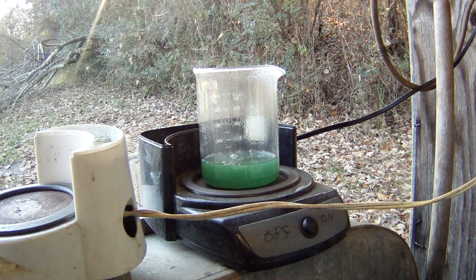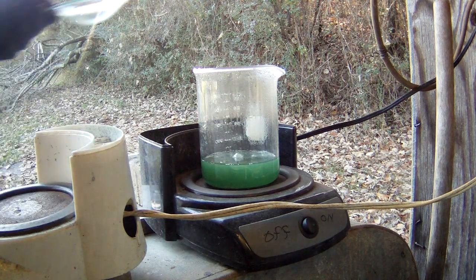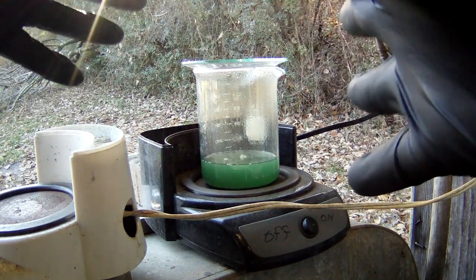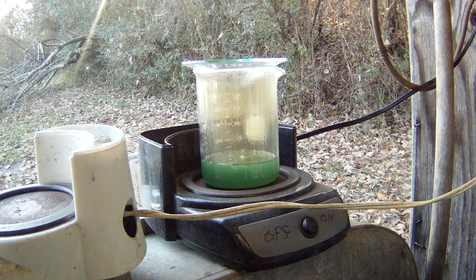Let me get my towel. And yeah, instantly we've got some more reaction again, so we still have quite a bit of material to dissolve in there. We're just going to go ahead and let it do its thing. And always remember, nitric acid, silver, wear your gloves or your hands will look just like that if you get it on them. It will stain you black as coal, and it'll last a long time. So we're just going to let that continue to react, and we'll be right back at you here in a little bit.